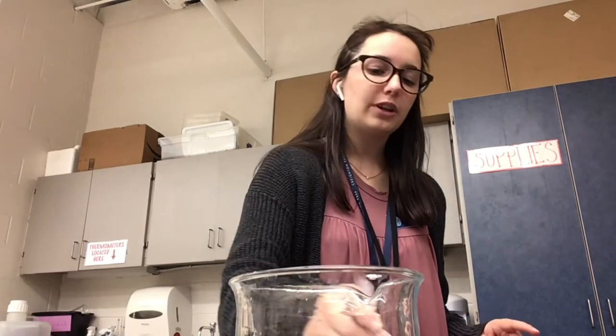Good afternoon, gentlemen. Today we're going to be completing the volume of a drop lab. At your lab station, you would typically have the procedure as well as this information, but for you it is posted on Canvas. I will talk about some introductory material before we begin, but make sure if you have any questions throughout this process to email me and I will help you.